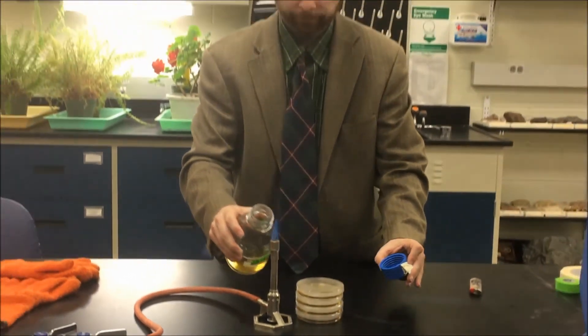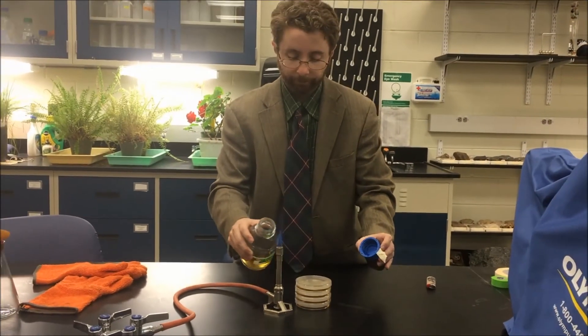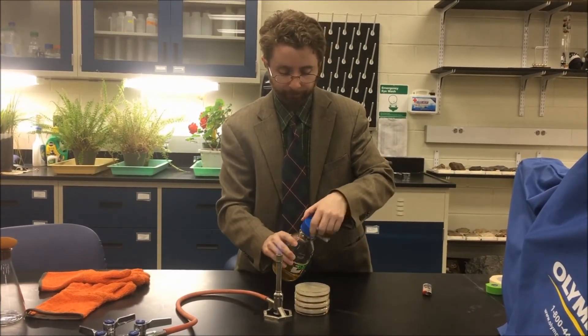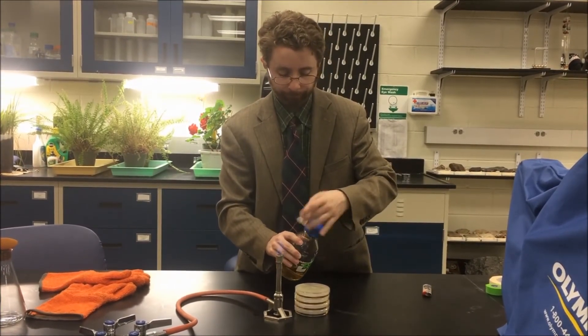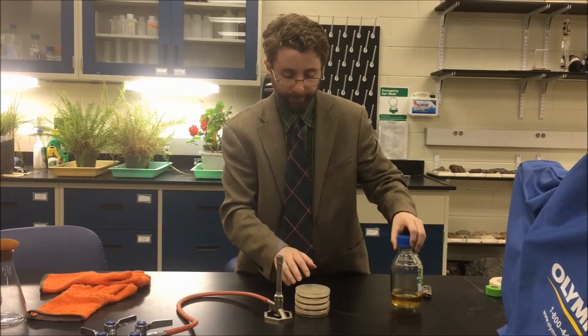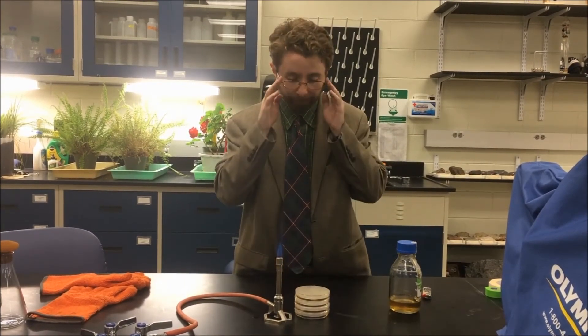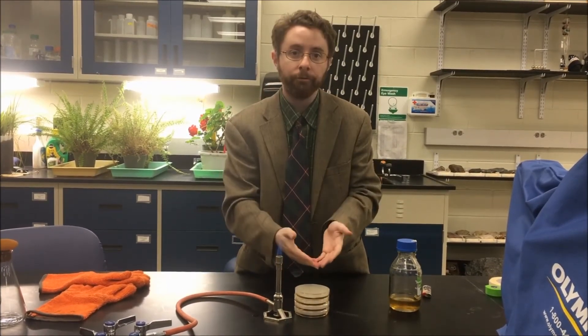When you're done, flame the lip and flame the cap, then allow these to cool and solidify. After they have solidified, you can store them either at room temperature if you're going to use them right away, or at four degrees Celsius if you're going to use them at a later date.